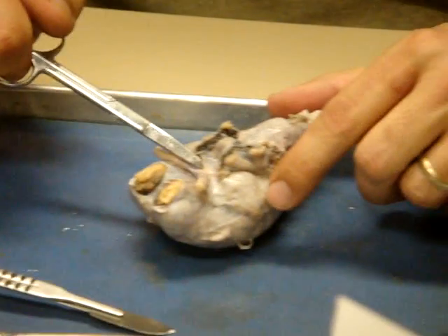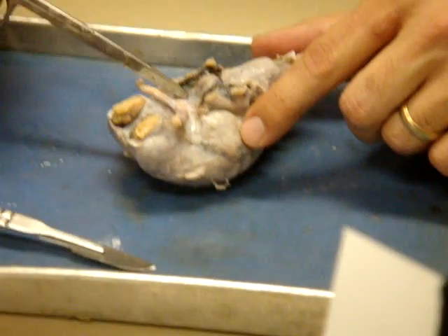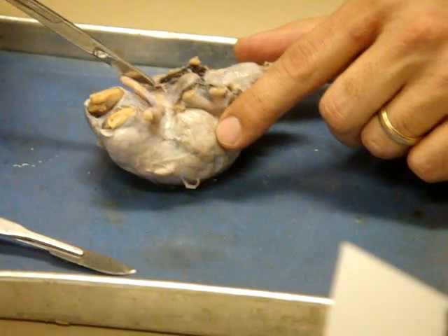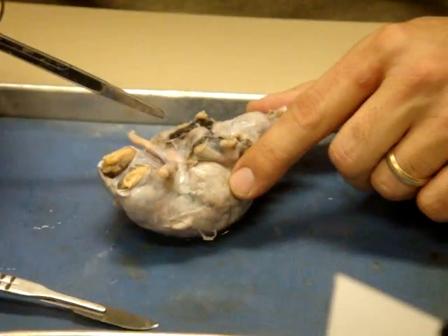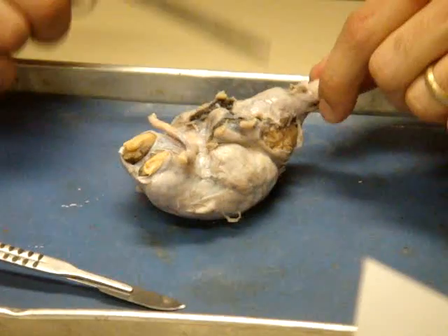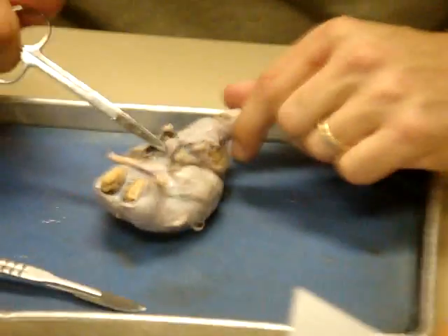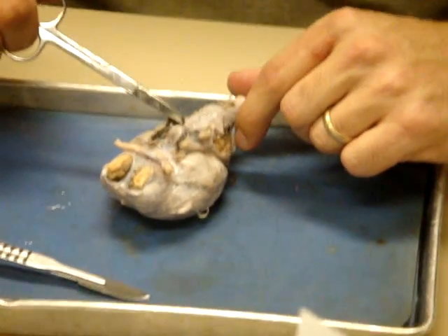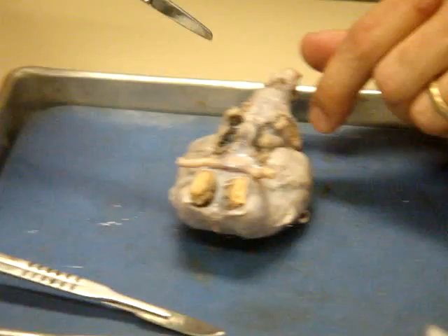I'll show you that in a little bit. And then they cross into the optic tracts. Optic tracts with a T. They're going to go back down into the brain tissue, and then where would they end up? What part of the brain? Occipital lobe. I mean, we're not going to go in that deeply and be able to follow it and see it, but we know that it ends up in the occipital lobe. Right here in the middle, this is what is going to be the pituitary gland right here. So it's hanging from an area of brain just above it, the hypothalamus.